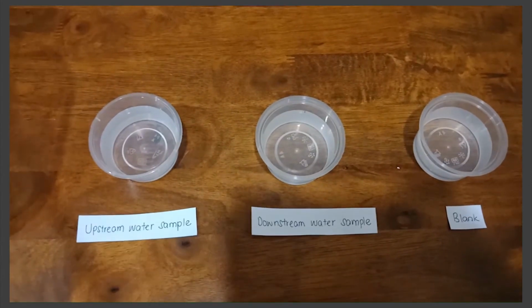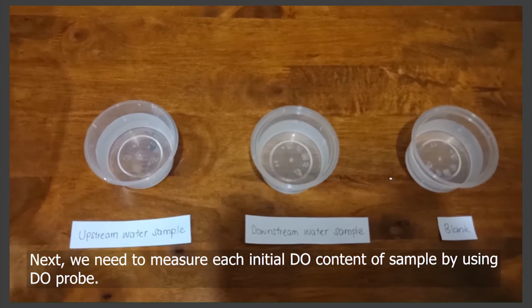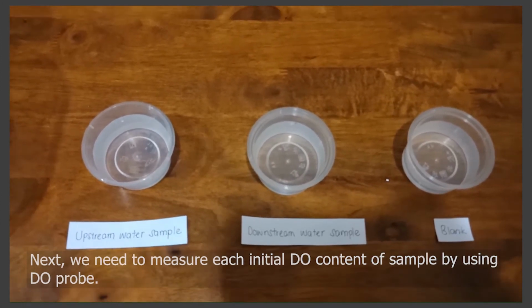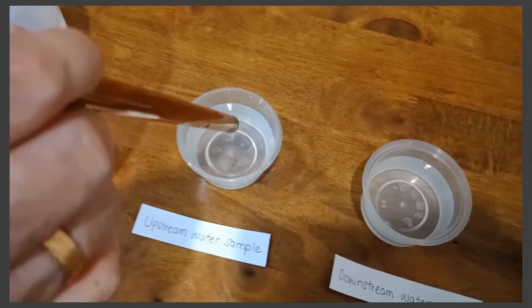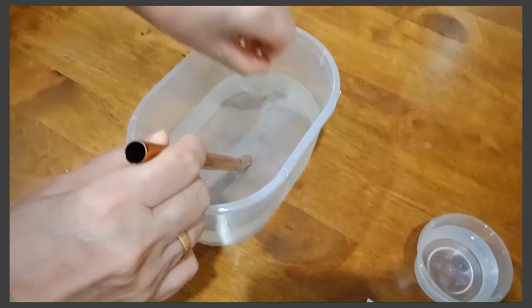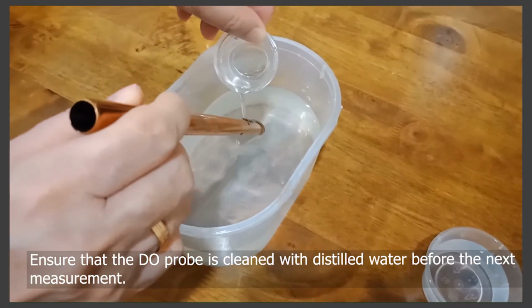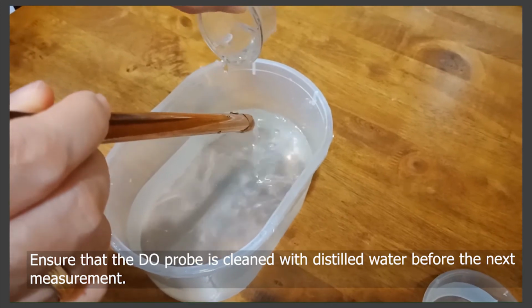Next, we need to measure the initial DO of each sample by using a DO probe. You must ensure that the DO probe is cleaned with distilled water before the next measurement.